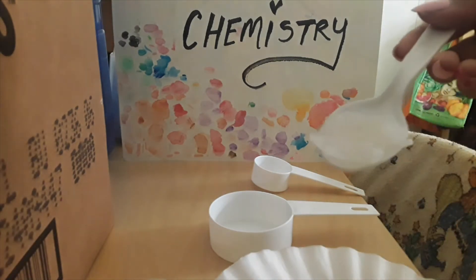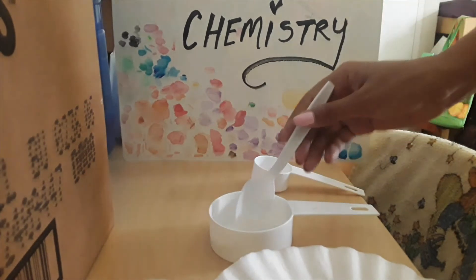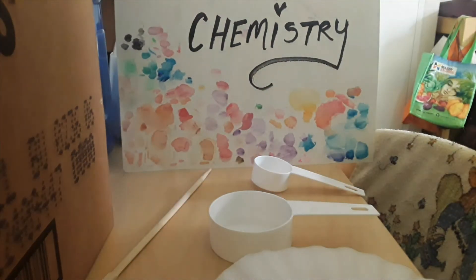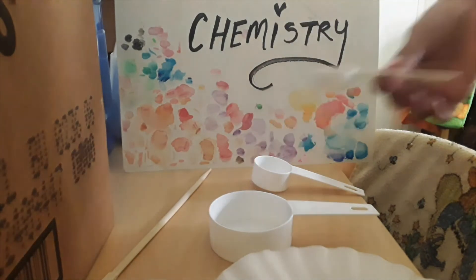This is the result of my labor. And now to get rid of these impurities, I'm going to recrystallize it using hot water. I added too much here — you're supposed to aim for the minimal amount.